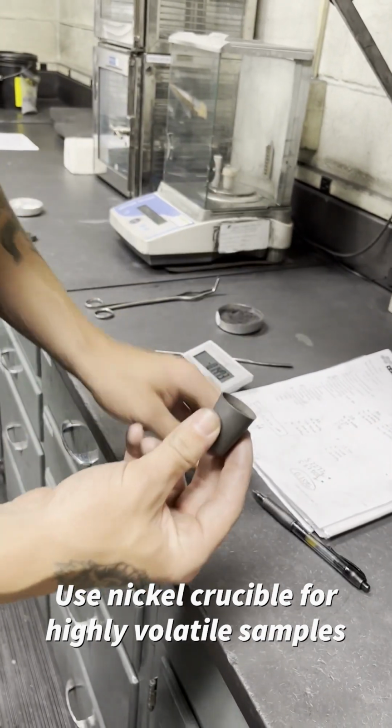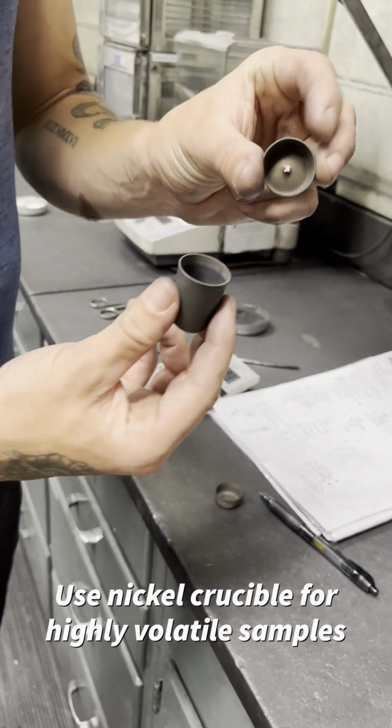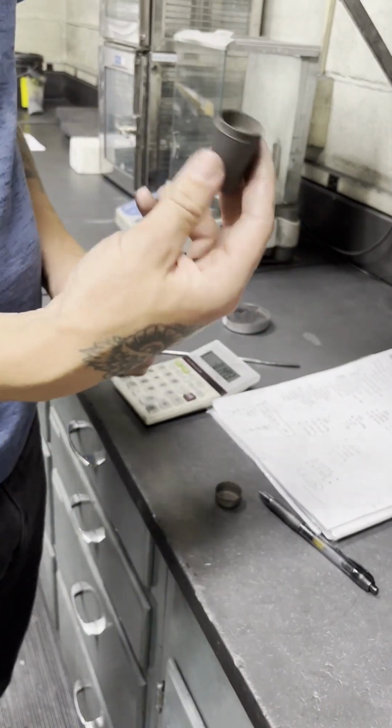If it still escapes, that's when you're going to have to switch and use a lid that has a hole in it to let the volatile gas drive off. That way no sample goes out during the test. And that concludes this procedure.